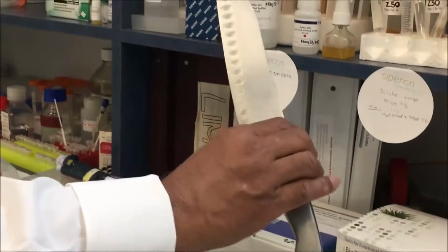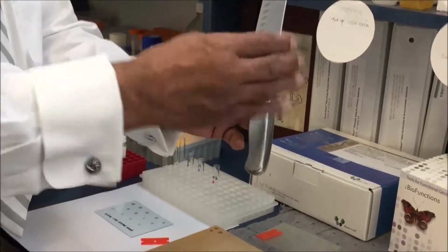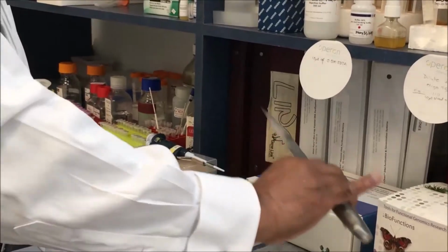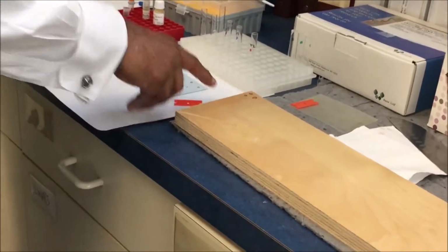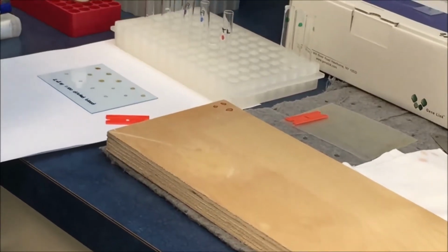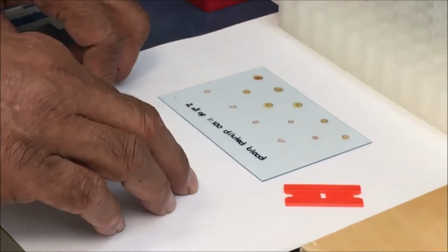If you notice that I'm holding this knife, just by holding it I'm depositing cells shed from my skin or hand, and I'm intentionally pressing it here, and then we will show you. Similarly, we have deposited blood samples just to make them visible. It could be invisible saliva or semen or any other biological fluid on a wood surface and on a plastic or glass surface. So these are the different types of substrates.